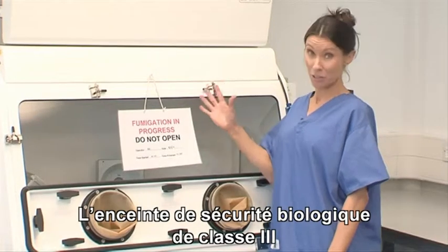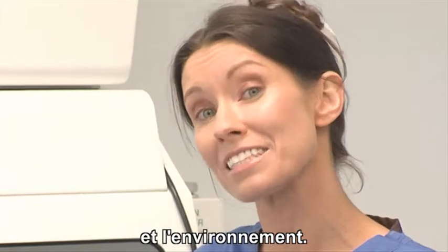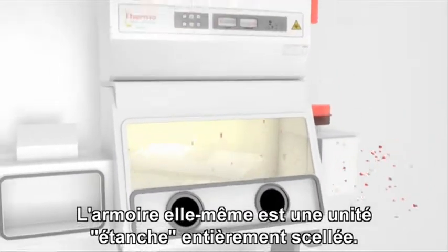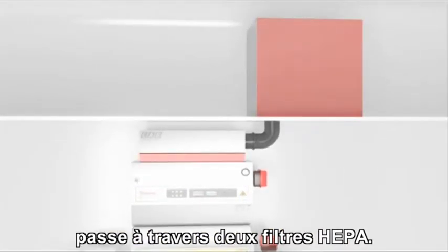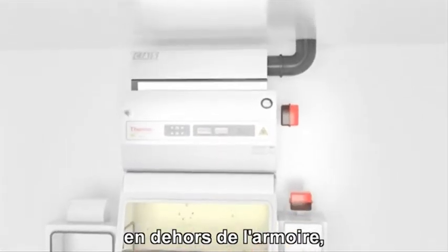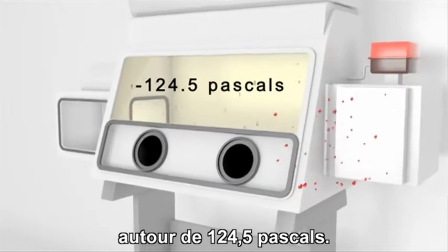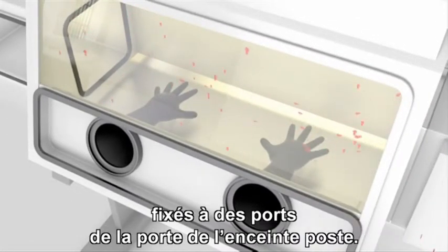The Class 3 biological safety cabinet provides the highest level of protection for personnel and the environment. The cabinet itself is a completely sealed, airtight unit. The air supply is HEPA filtered and the exhaust air passes through 2 HEPA filters. Airflow is maintained by a dedicated exhaust system outside of the cabinet, which keeps the cabinet interior under negative pressure, around 124.5 pascals.